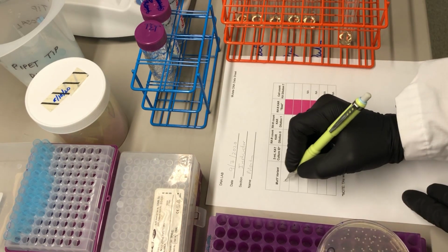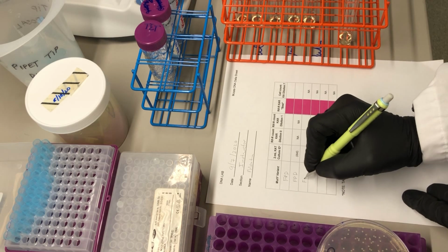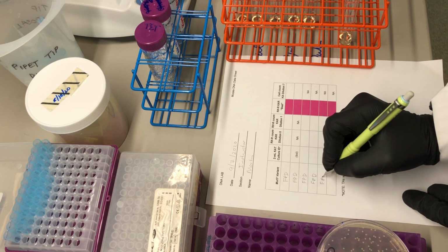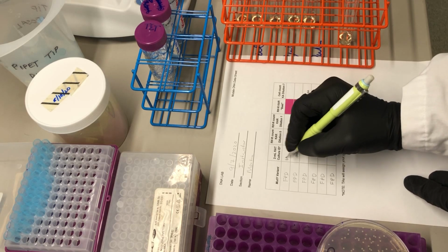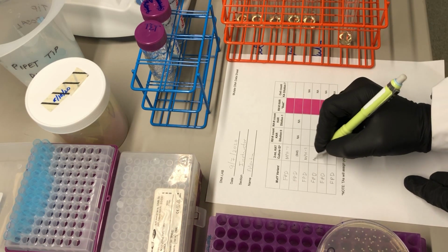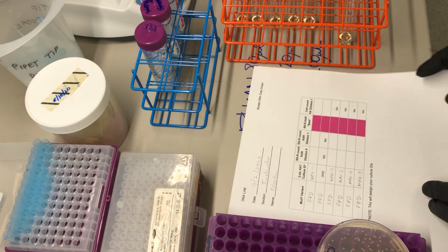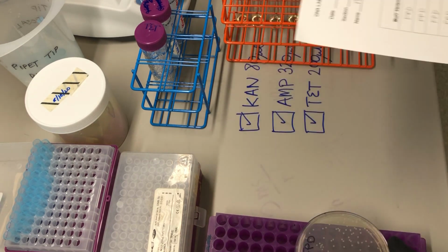So I'm going to write here FPD, and that has a symbolic meaning. It means that in this region of structure that we're calling the FSH loop, the amino acid residues are phenylalanine, proline, and aspartate. And the culture ID, that's what I put on the tubes. MPH1, MPH2, MPH3, MPH4, MPH5. And all of these cultures, all 5 of them, will be from the cells in one of these colonies.